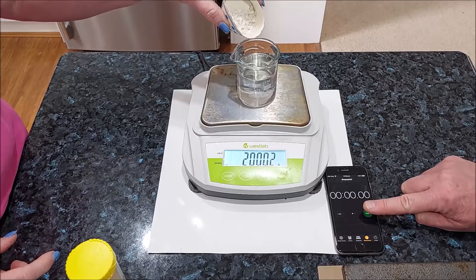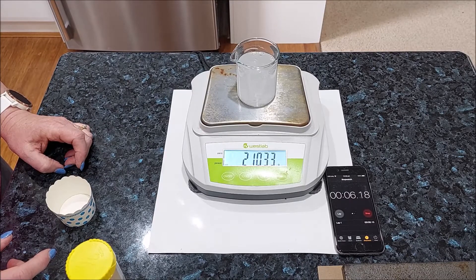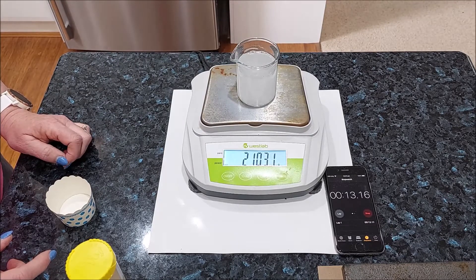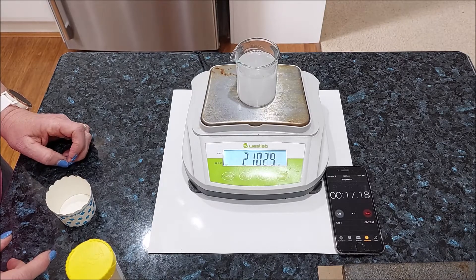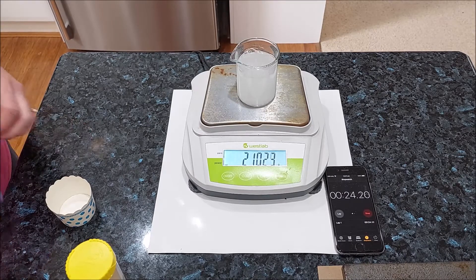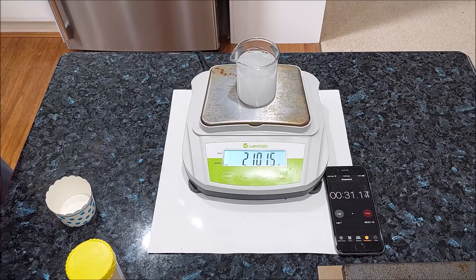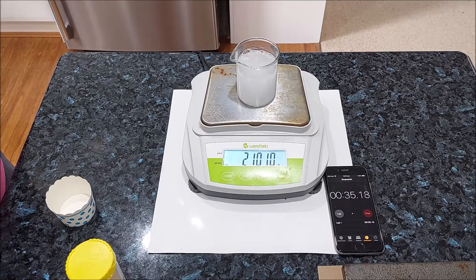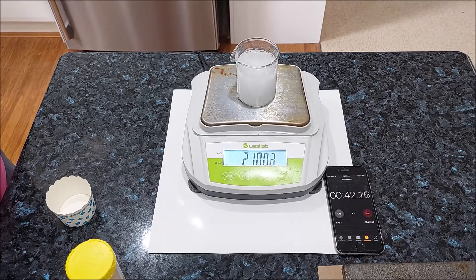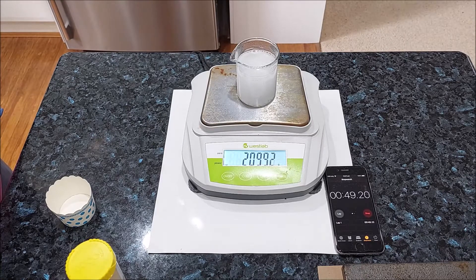Ready, set, go. As the carbon dioxide is produced, my mass is decreasing. Every 20 seconds I want you to note down the mass. We can calculate the mass of carbon dioxide being given off by subtracting our mass from the original mass.